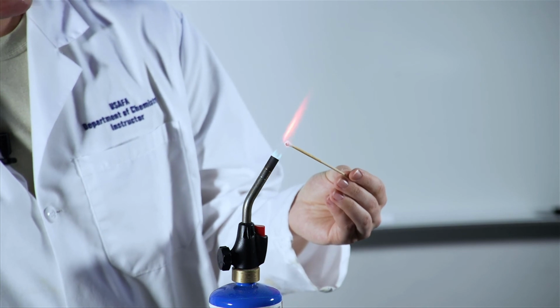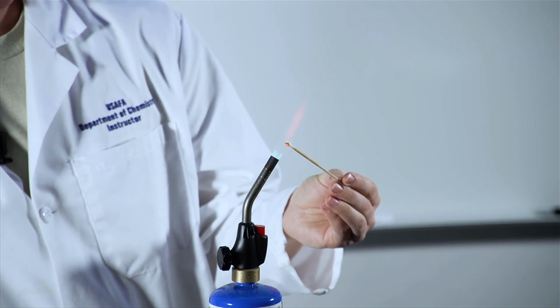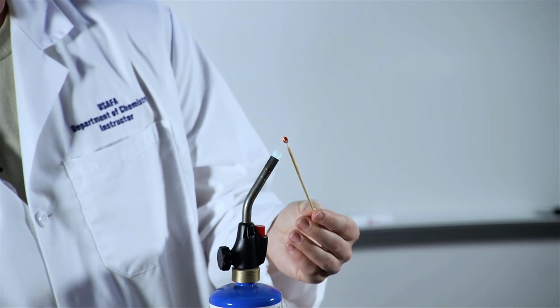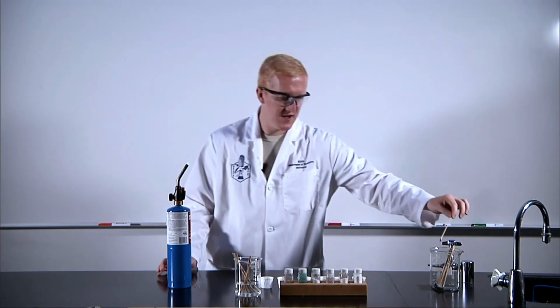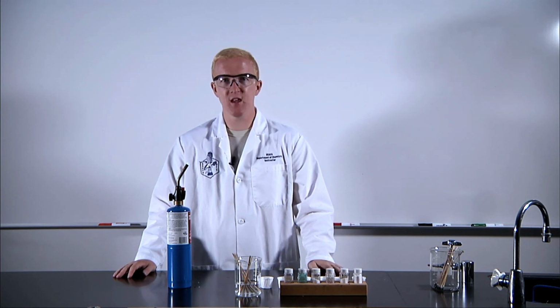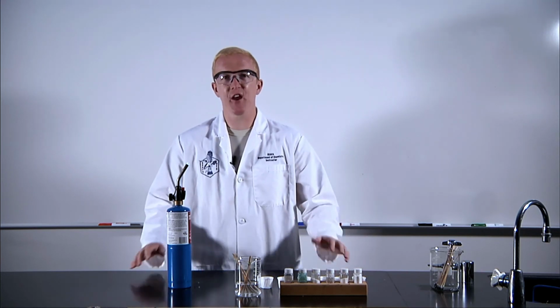One of the cool ways that you can take this to the next level is if you look at any of these lights through a prism, you can see distinct lines of the wavelengths that are being emitted. I think we lost all of our salt here, it kind of melted off, but one of the really cool things is, if you can isolate your metal in a salt, put it in some kind of clean burning flame, you get to see some pretty neat colors. And that concept is used throughout chemistry to try and figure out what's going on.